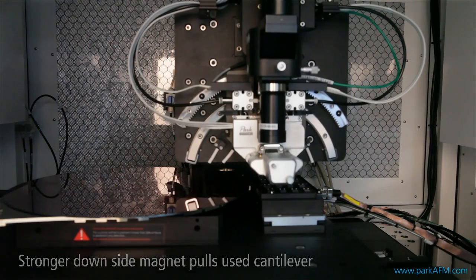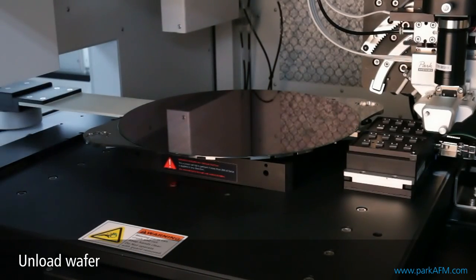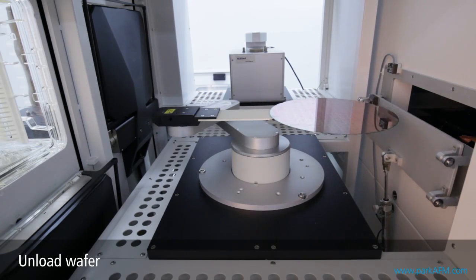All procedures leading up to the restoration of the measured wafer to its original location can be carried out automatically.